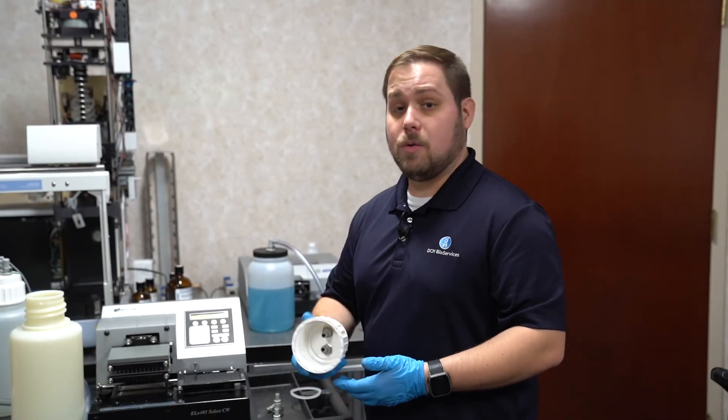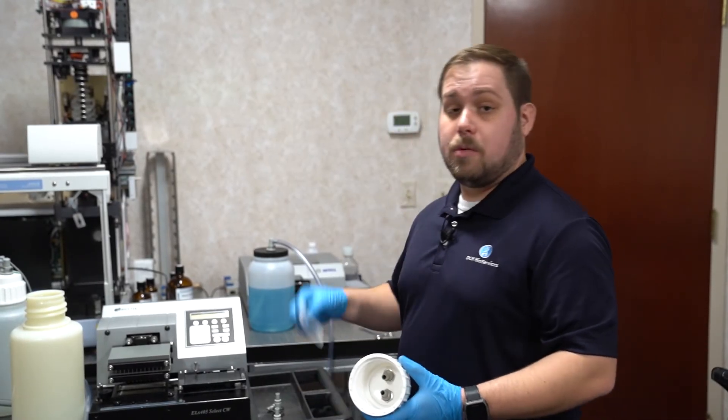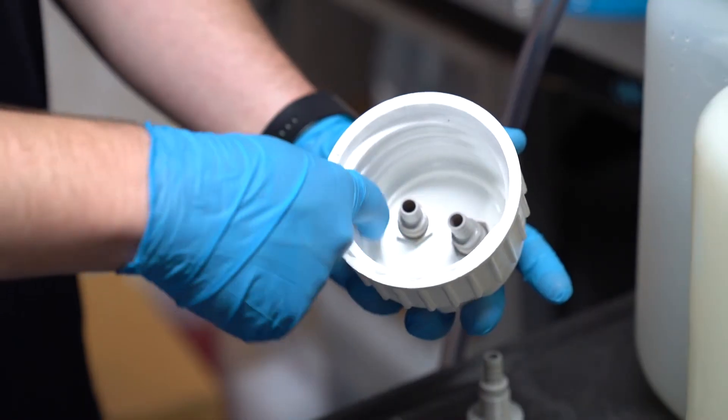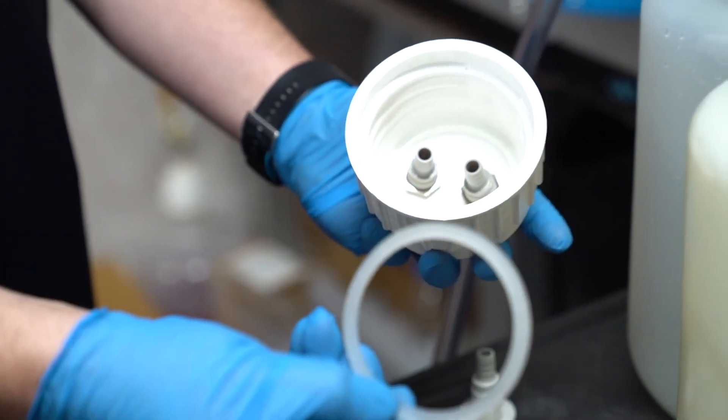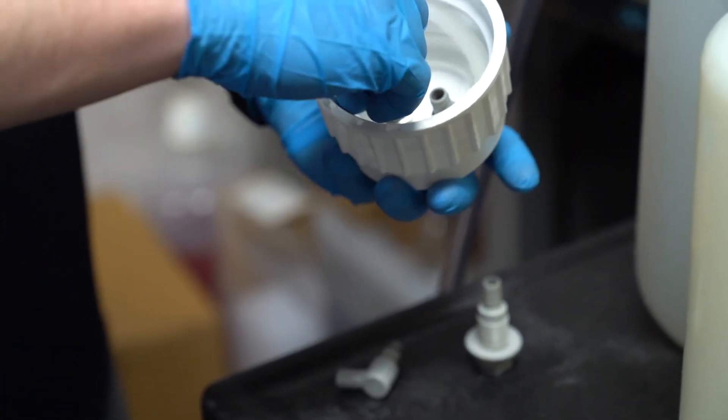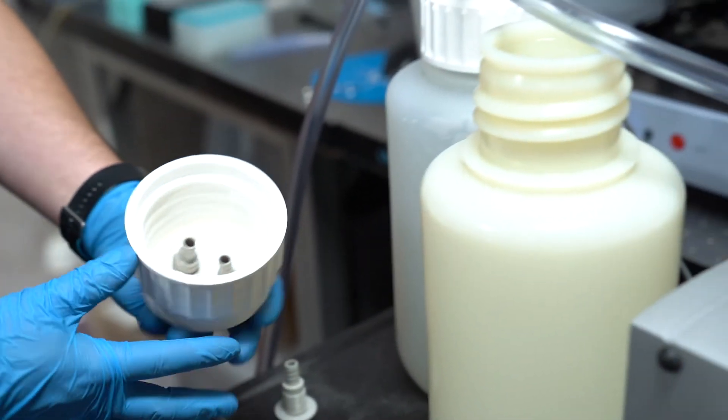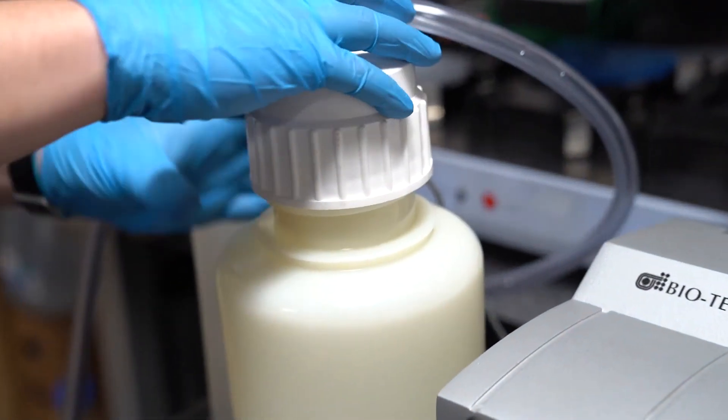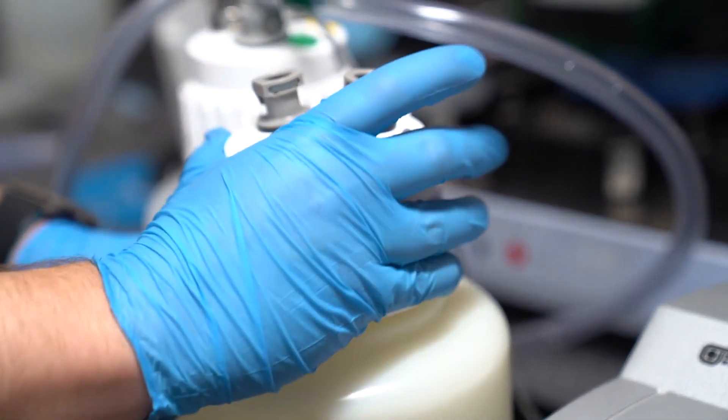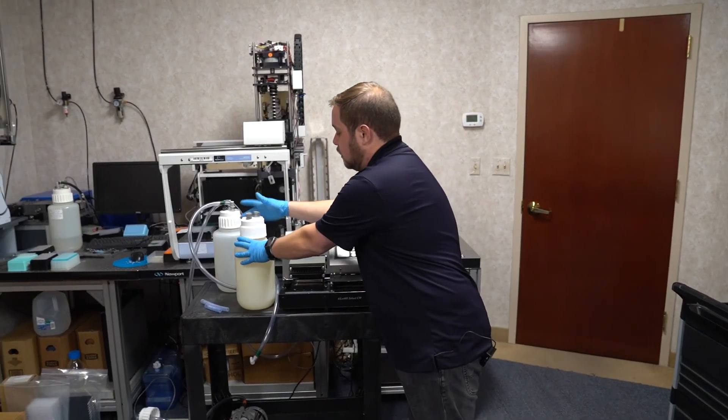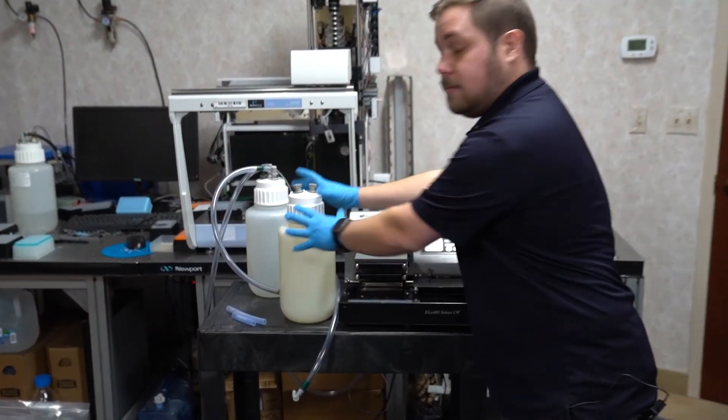With the cap itself, if an o-ring is missing, you can order a replacement from Nalgene and simply insert it into the lid down along the ridge at the top of the cap. It doesn't need to be pressed fully as it'll be tightened down when we reinstall it on our waste bottle. Just get it within the ridge and tighten the waste bottle down how you normally would.